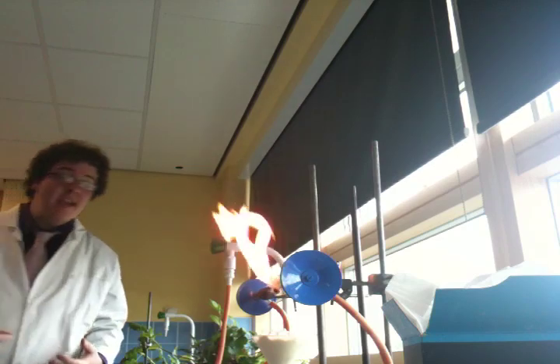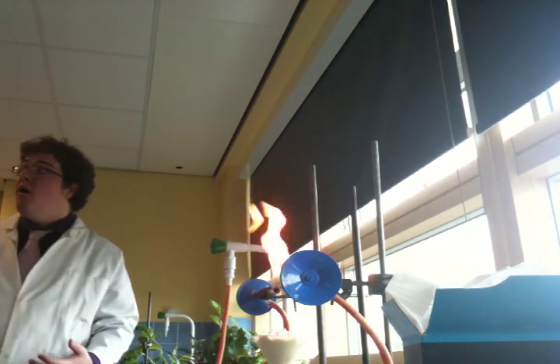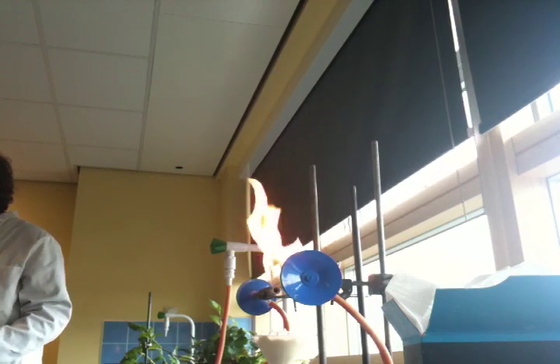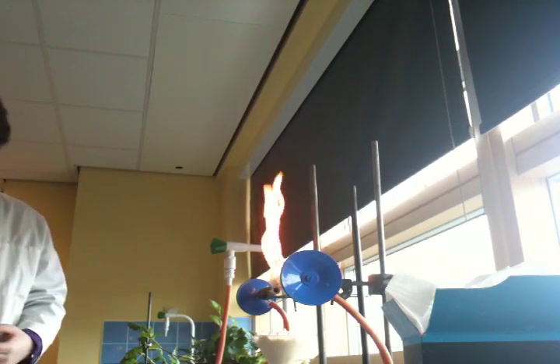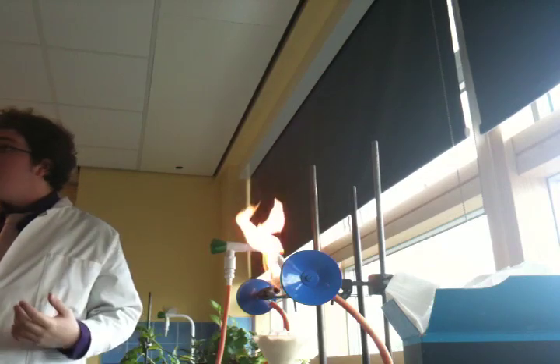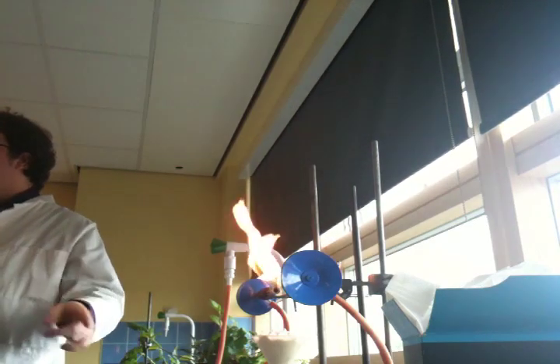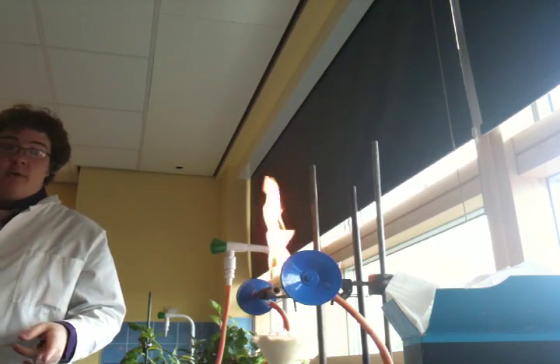Now, what that means is that more of that flour can react at any one time. Now, what that means is that, hopefully, fingers crossed, the reaction might go slightly faster than when we did it on the white tile just a second ago.